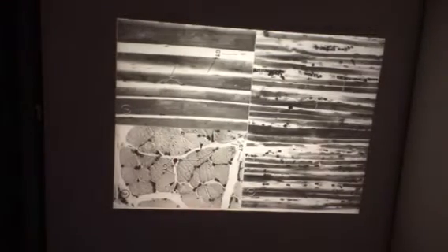A-bands, I-bands can be demonstrated on this lab practical. Sometimes the Z line, but it's a little bit tough from time to time. What is this layer we see right there? Perimysium, and then surrounding each one of these is an endomysium. And this tissue is what? Skeletal muscle.